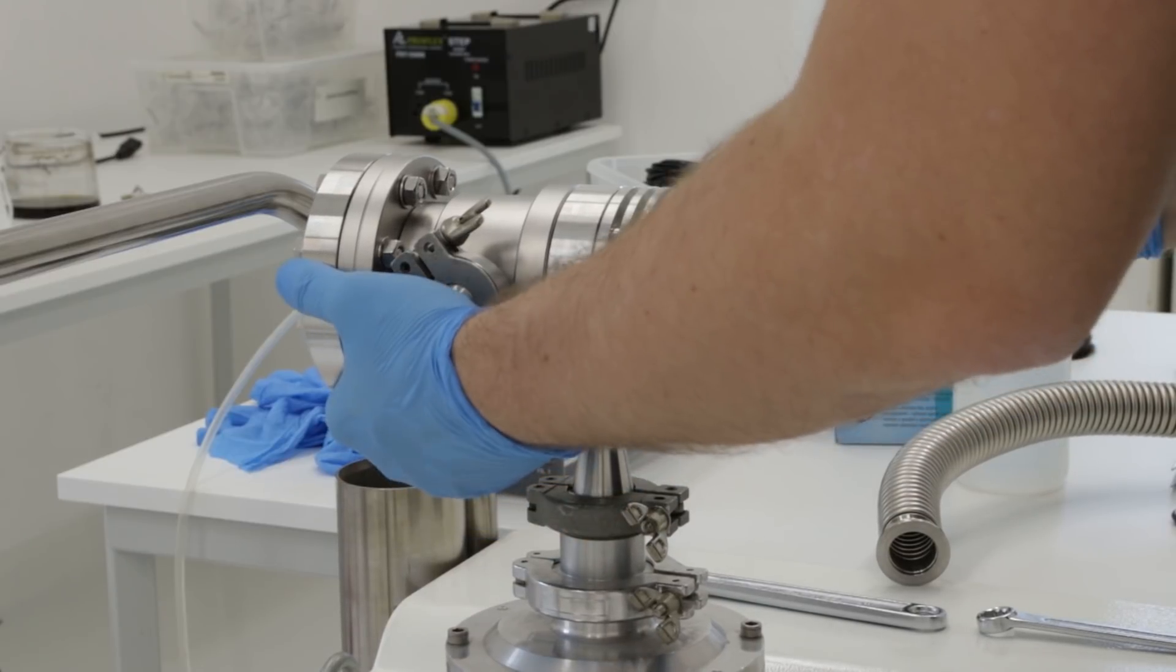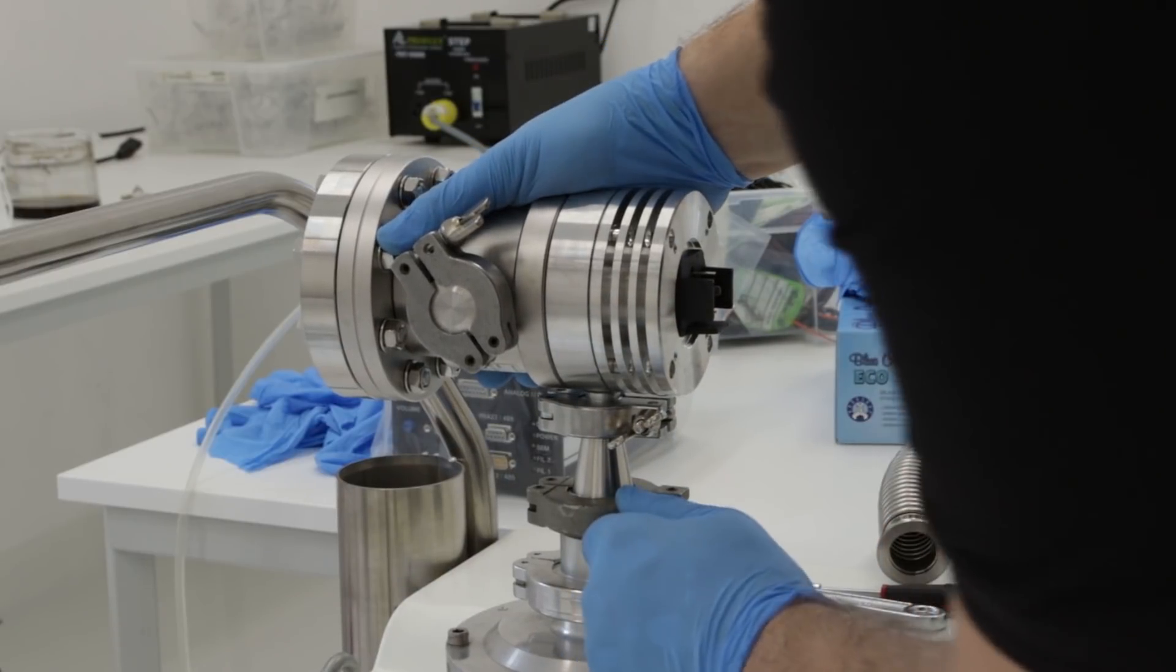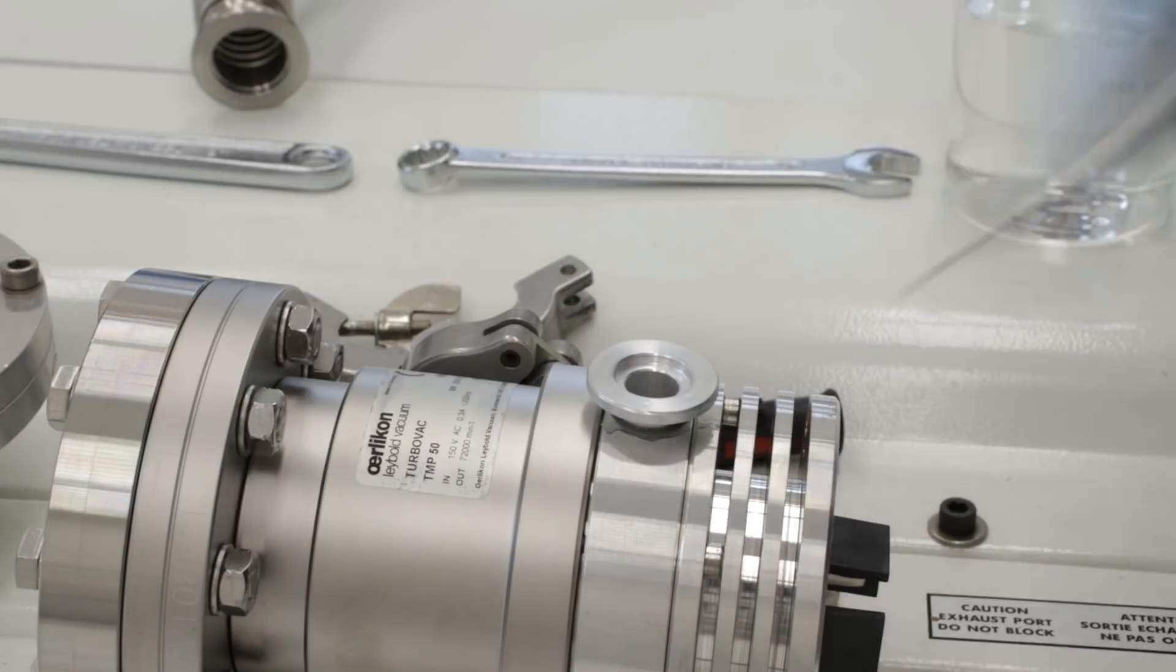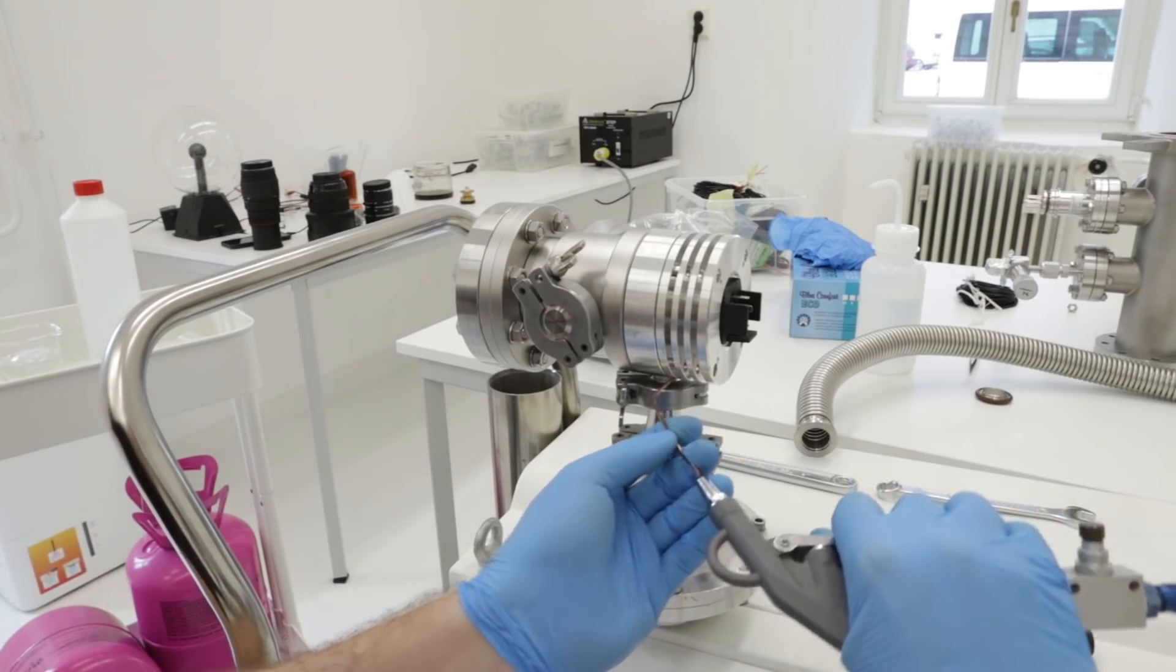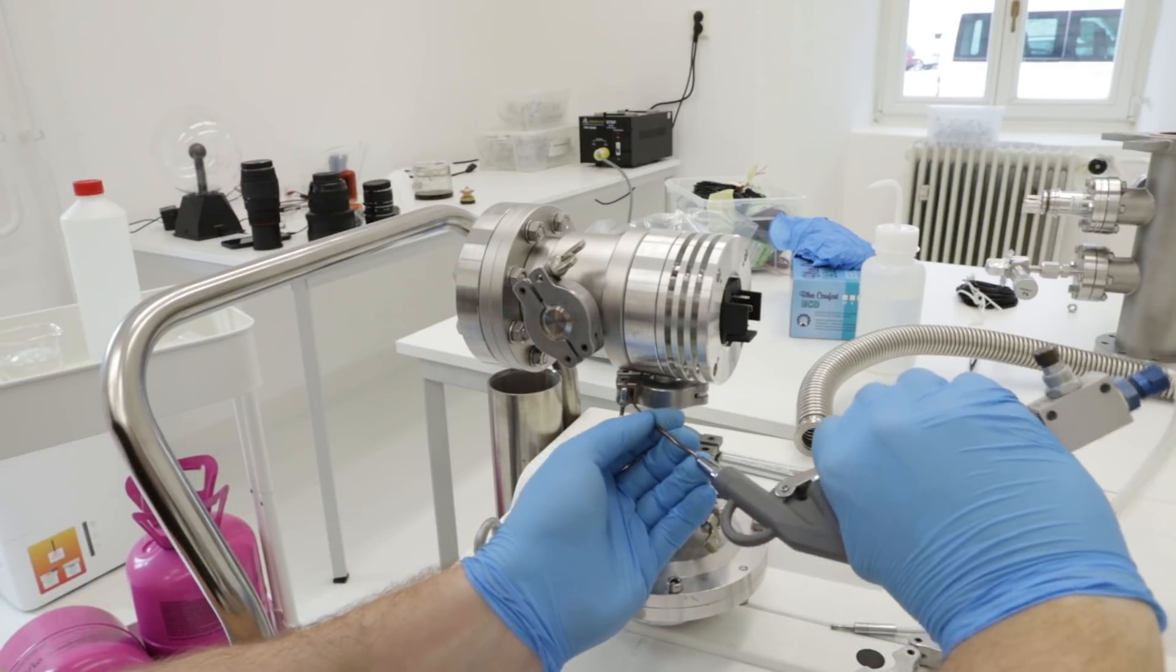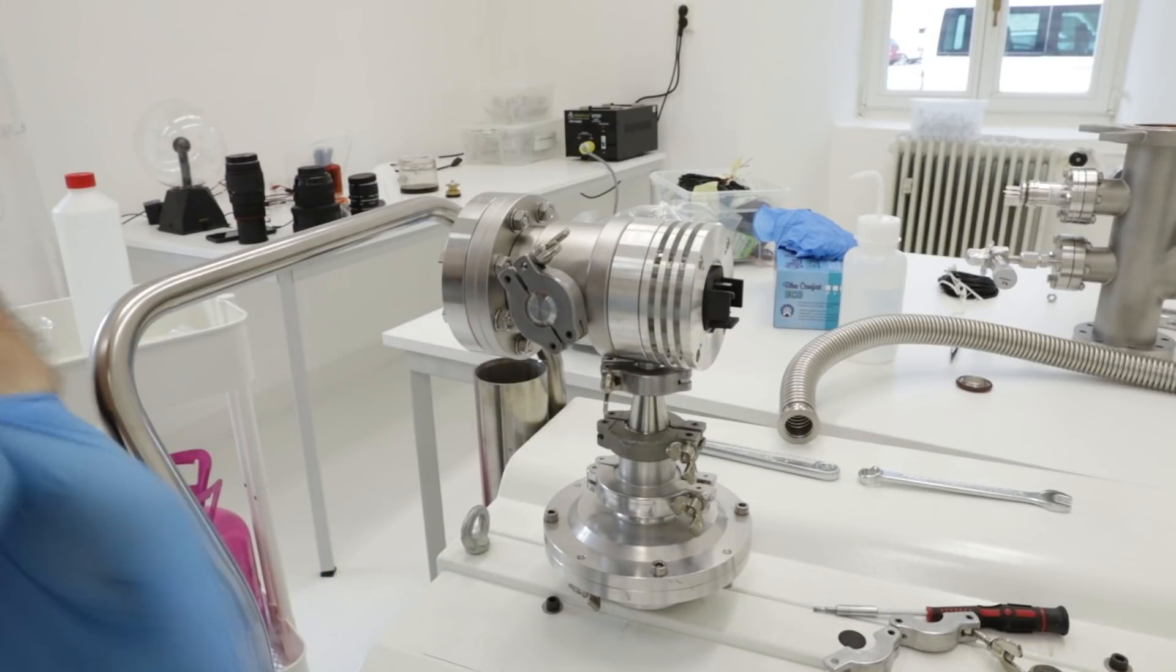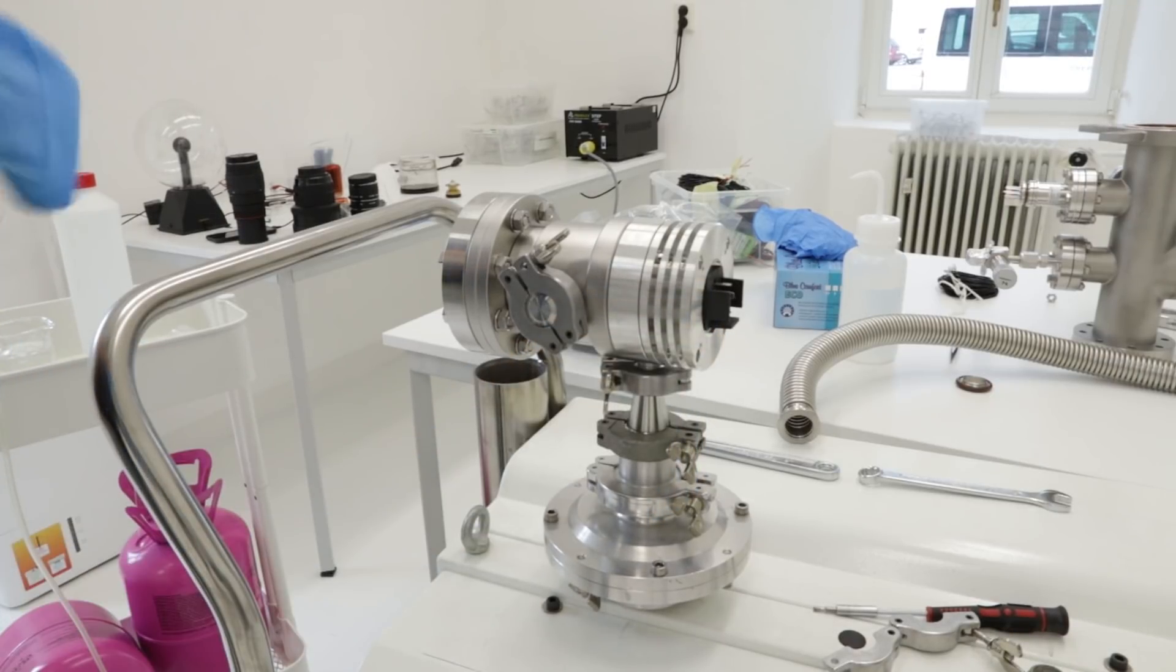The confusing thing might be that I'm not spraying the helium around - it's now in the room all around the tube or in all the connections, so I don't need to spray the helium. The only other seal where helium could enter the chamber is this epoxy seal, so I'm covering it with leak sealant to see if it makes any difference. So it seems the leak disappeared. You can hear that the tone is not responding to spraying helium, which means there's no leak anymore. Yes, looks like it. Okay, so it's weird. I will not play with this anymore and I will replace all the bottom part of the turbo.